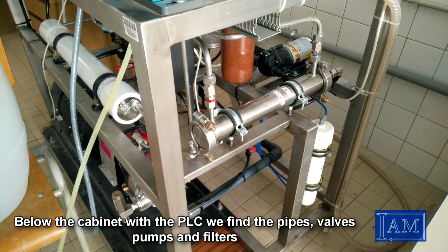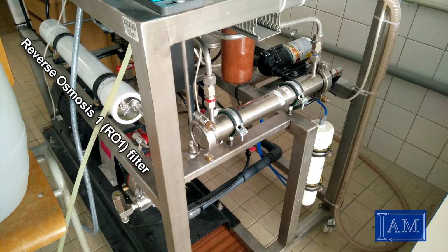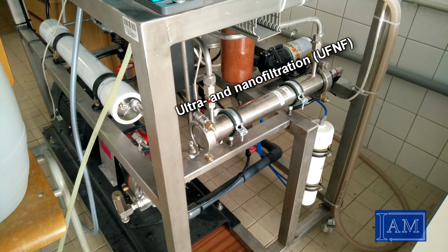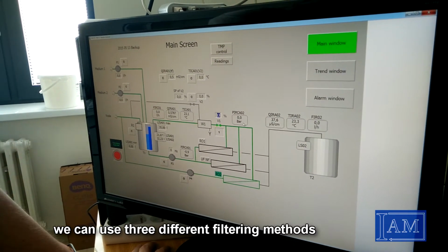Below the cabinet with the PLC, we find the pipes, valves, pumps and filters. This is the reverse osmosis 2 filter. On the left we will find the reverse osmosis 1, and in the middle we can find the ultra and nanofiltration. We can use 3 different filtering methods.